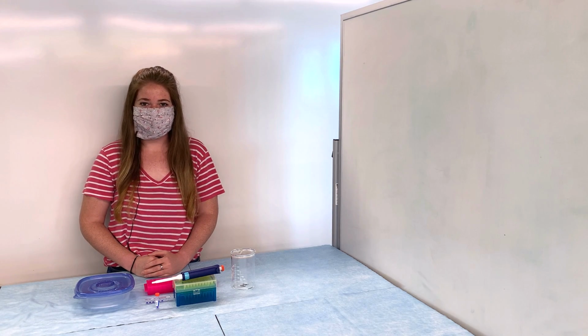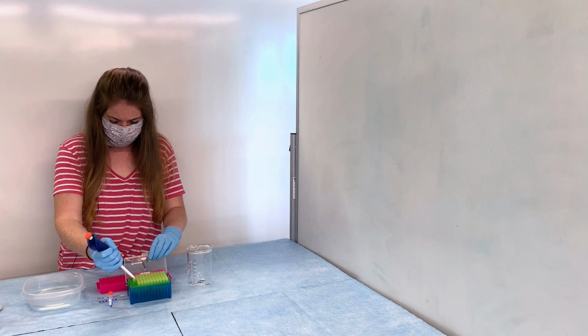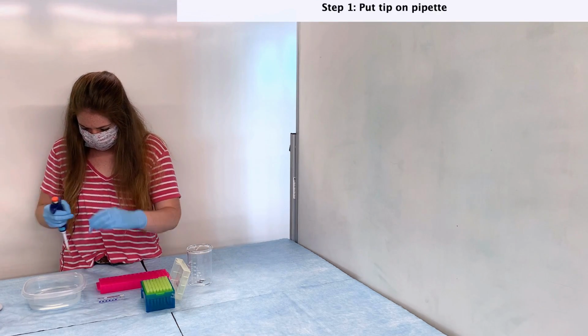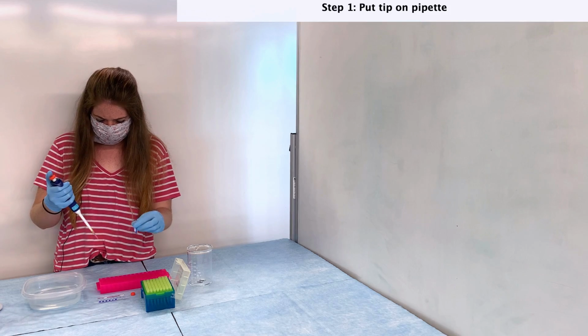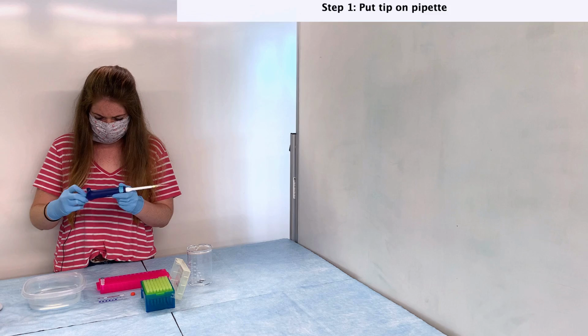So let's get started. I'll narrate the process of loading the first well, although this should be very familiar to you from our last lab. So first I'm going to put a tip on the pipette. Remember, you can't use a pipette without a tip. Now I'm going to locate the sample. Remember, for the first 2 wells, it's just a practice dye, not a DNA sample. I'm also going to adjust the volume the pipette will be extracting by twisting the button on the top.